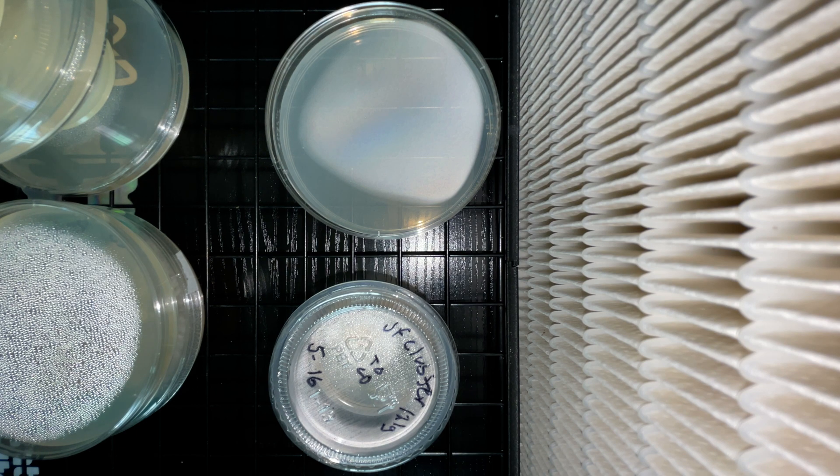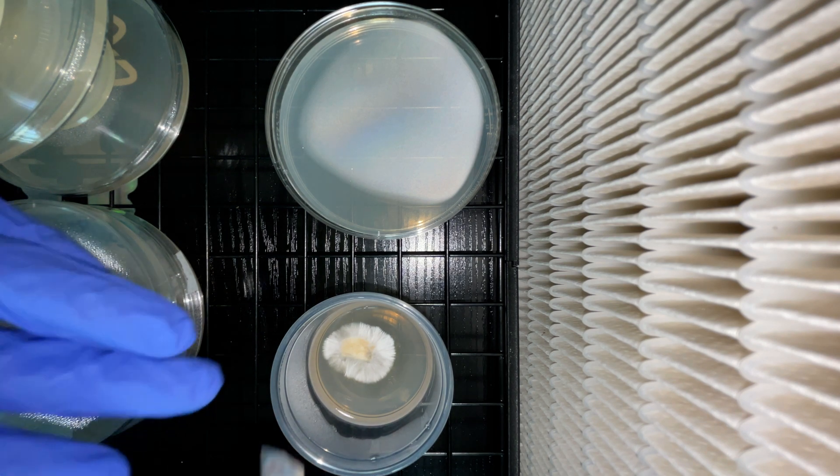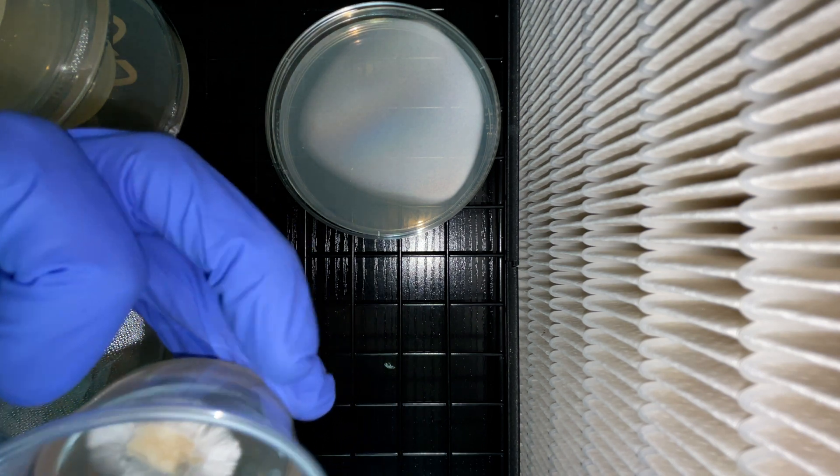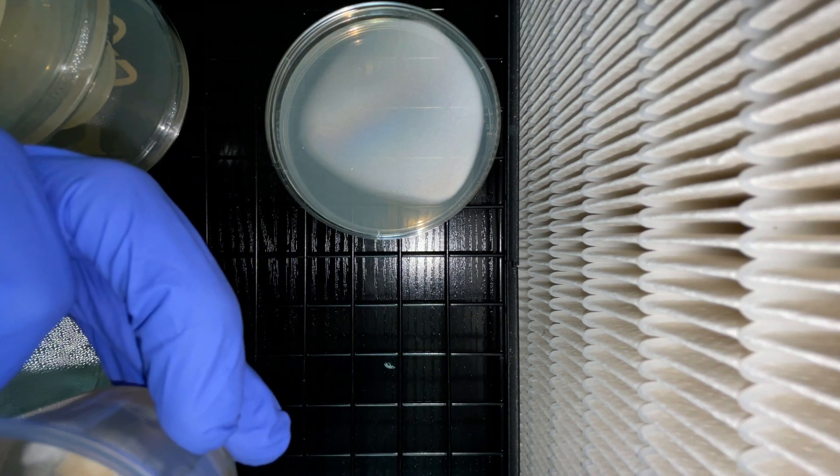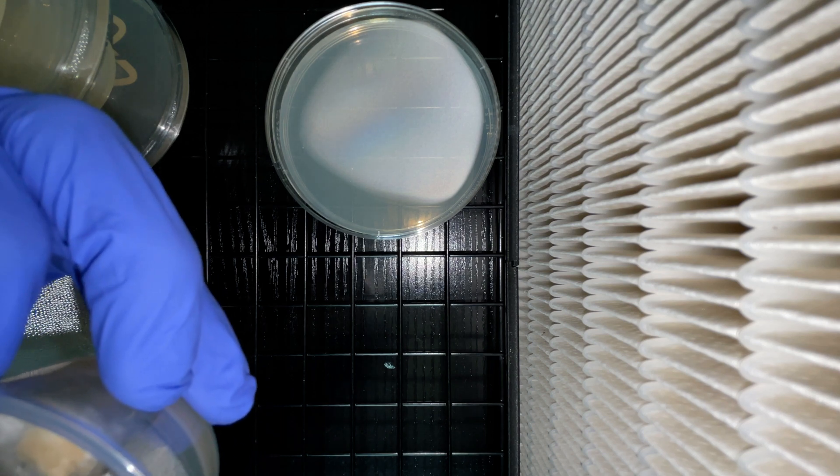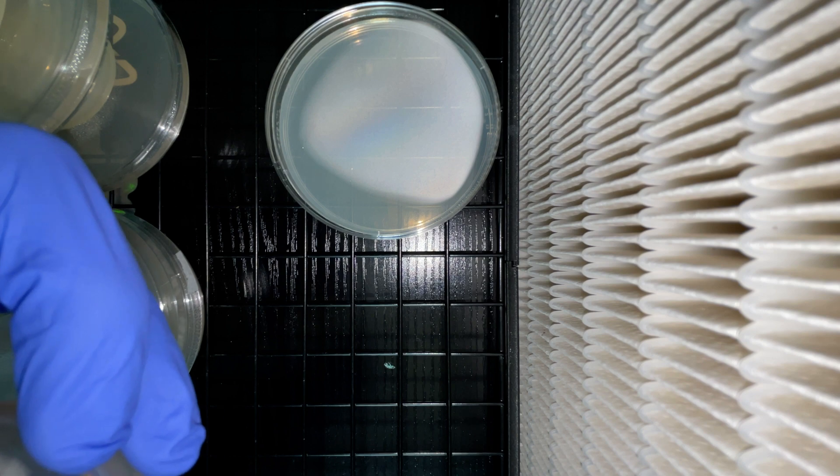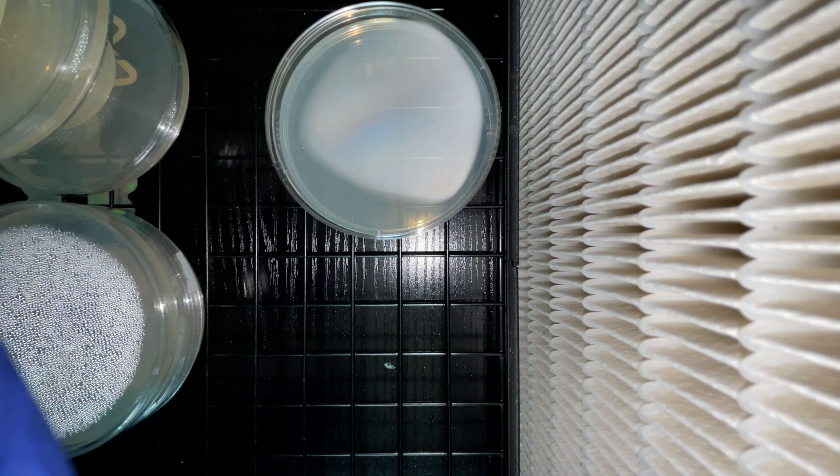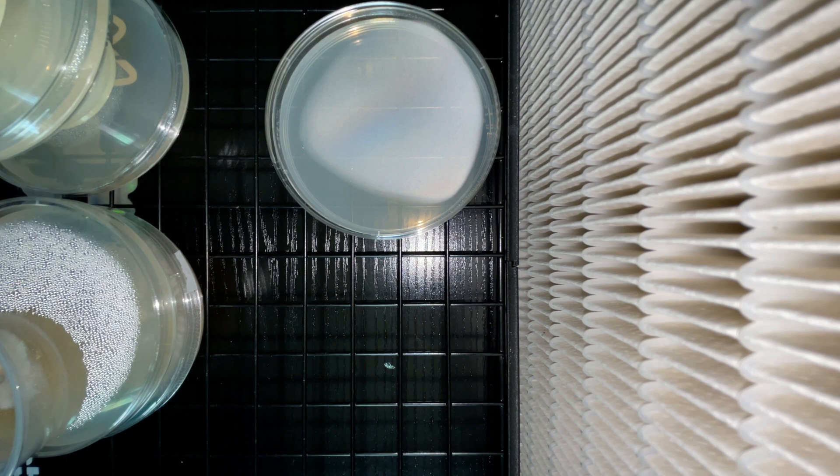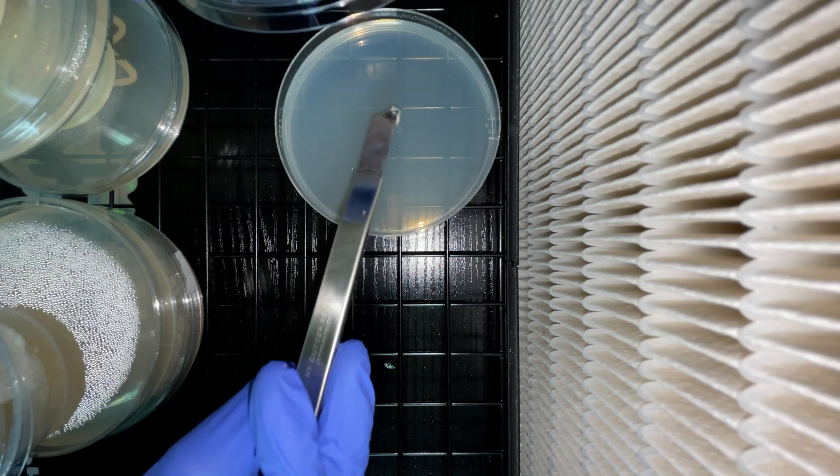All right, to finish our last bit of the cloning projects, I'll walk you through real quick what I'm looking for: the fastest, most rope-looking formation in the best cluster. More info on that in my agar work video. I'd also like to mention that a few of these cultures come from some of my close friend's cold storage. A couple of these original plates were dated almost four months old. Each and every single one of them started off initially good on the cups with very minimal contamination. So here's me moving them to full plates to grow out and make sure that they're clean before sending to grain.